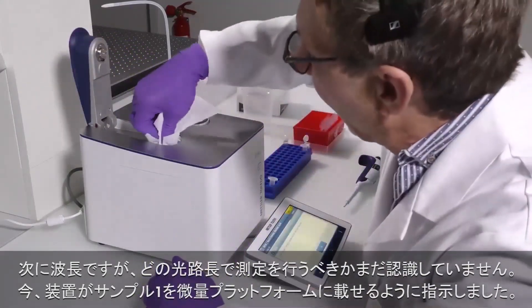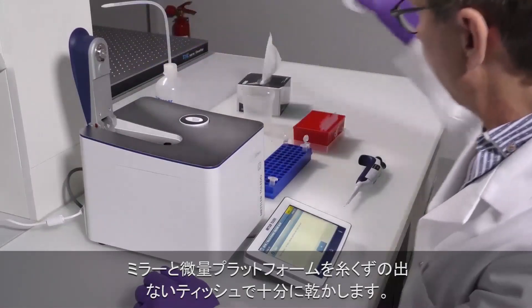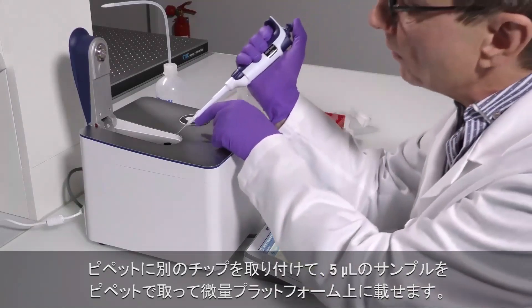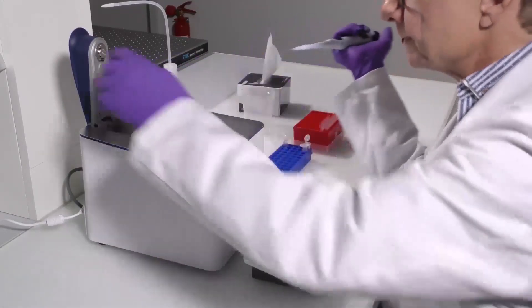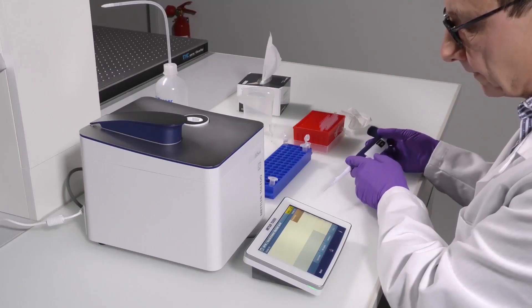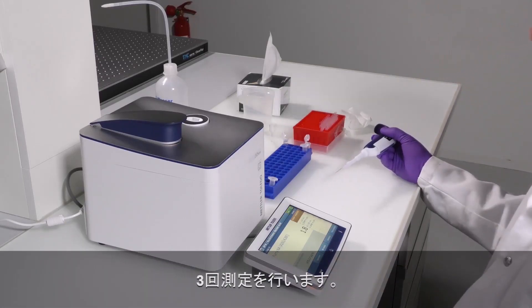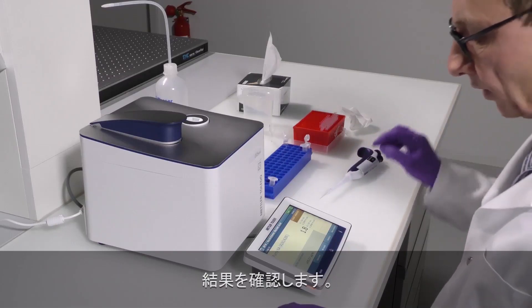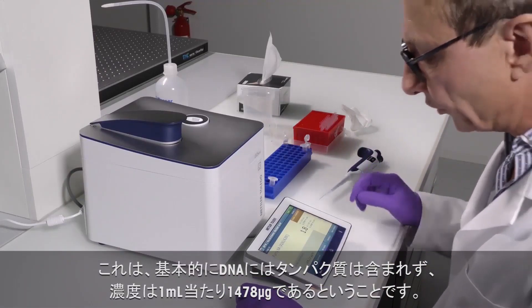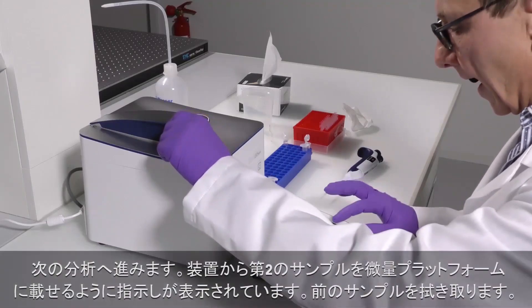Now it asks me to put sample 1 onto the microvolume platform. I carefully dry the mirror and the microvolume platform with a lint-free tissue. I put a new tip onto my pipette and pipette 5 microliters of the sample onto the microvolume platform. I close it and confirm. The measurement is done. We have told the instrument to perform a threefold measurement. The purity is 1.8, which means that the DNA basically does not contain any proteins. The concentration is 1478 micrograms per milliliter.